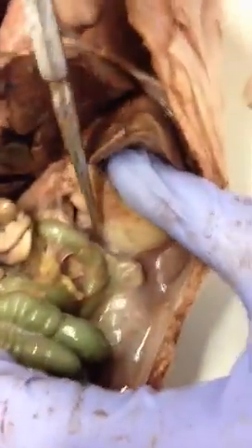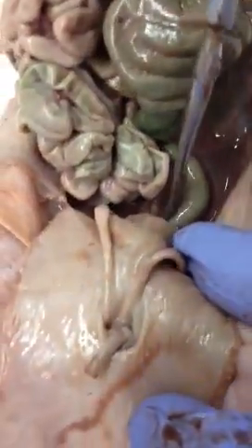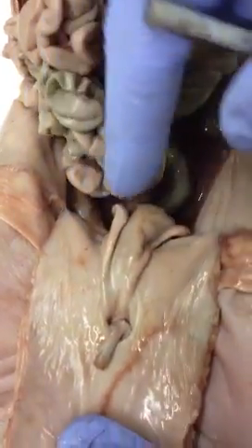The pancreas is this grainy stuff surrounding the large intestine, which is about to become the descending loop. And behind that is the kidney — here's the left kidney, and here's the right kidney. You've got the descending part of the large intestine. This here, still attached to the body wall, is the bladder.